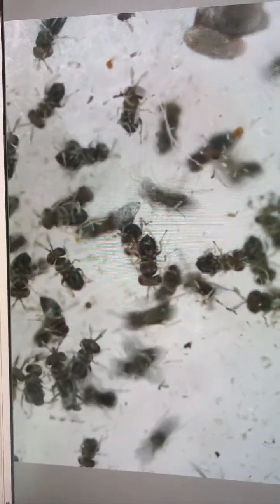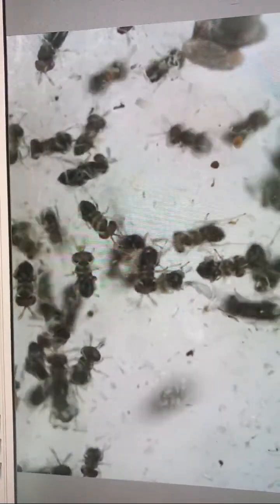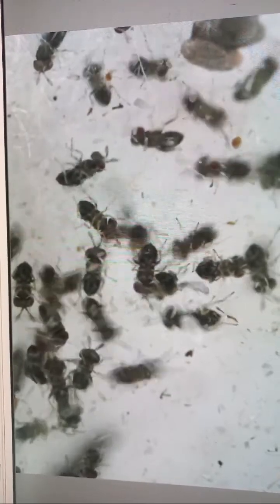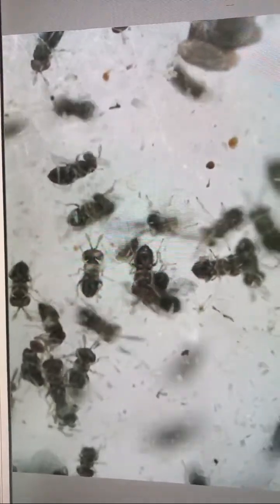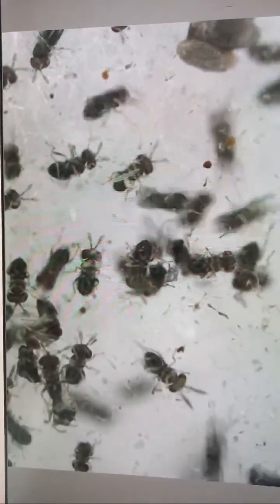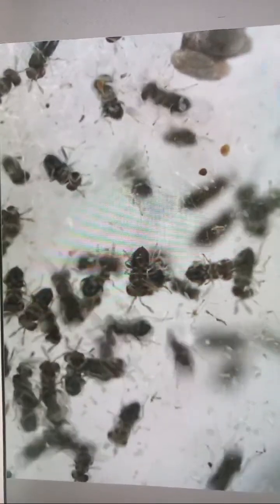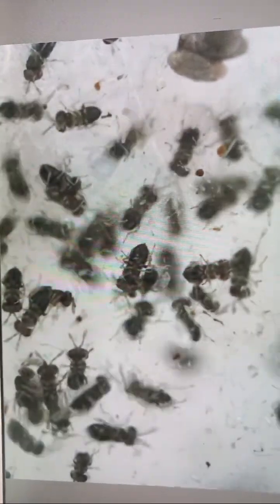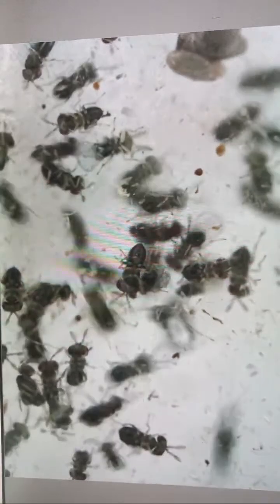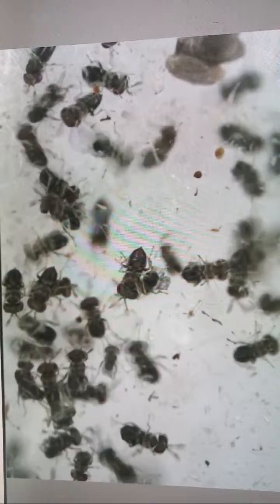and just enjoyment to watch interesting insects. Interesting insects which have very small size, extremely small size, but we are crawling, we are jumping, we are flying here in petri dish. We are watching in petri dish under the very high magnification of microscope with use of computer, which is a little bit freezing the movement.